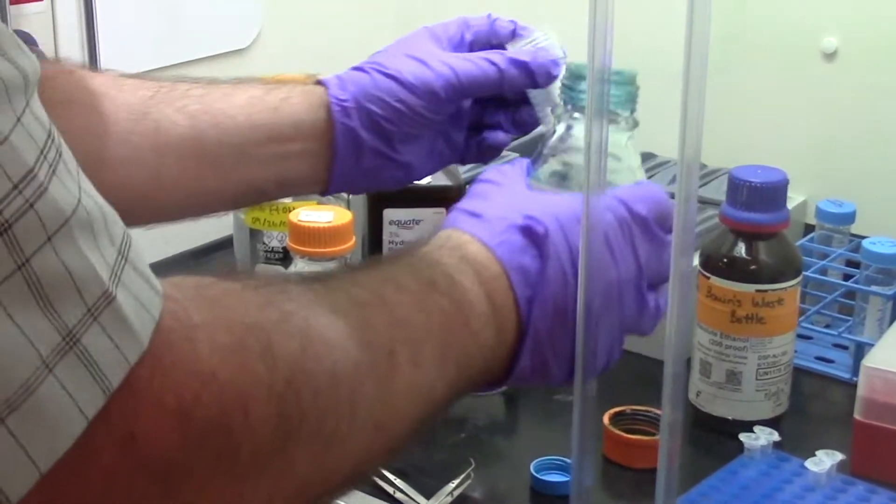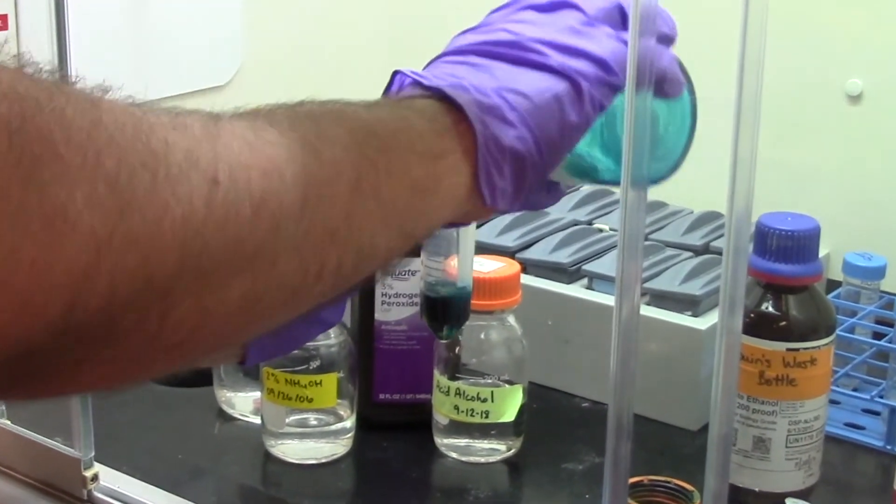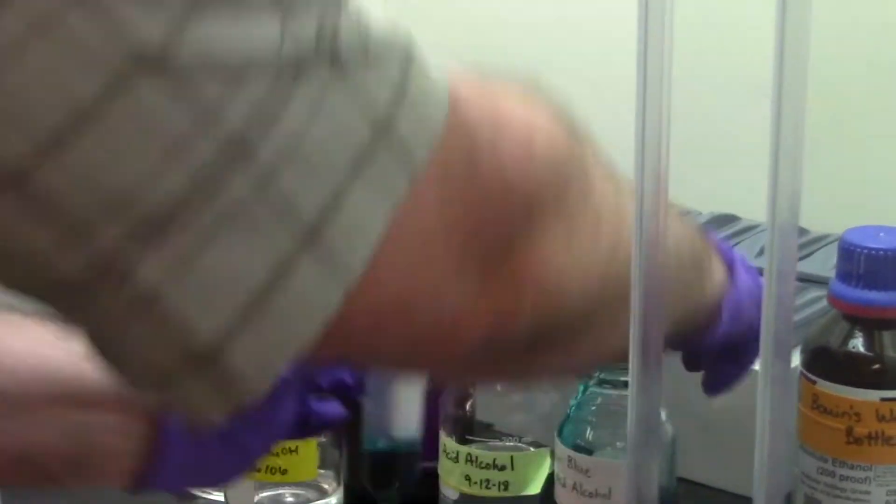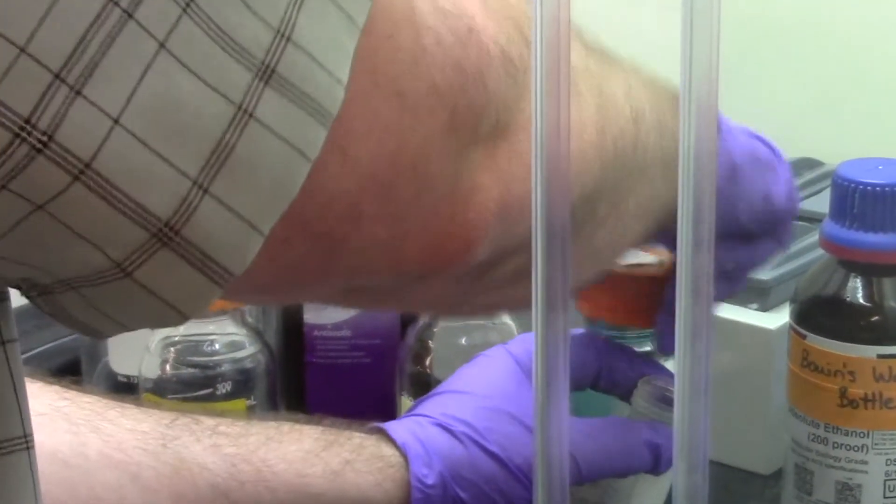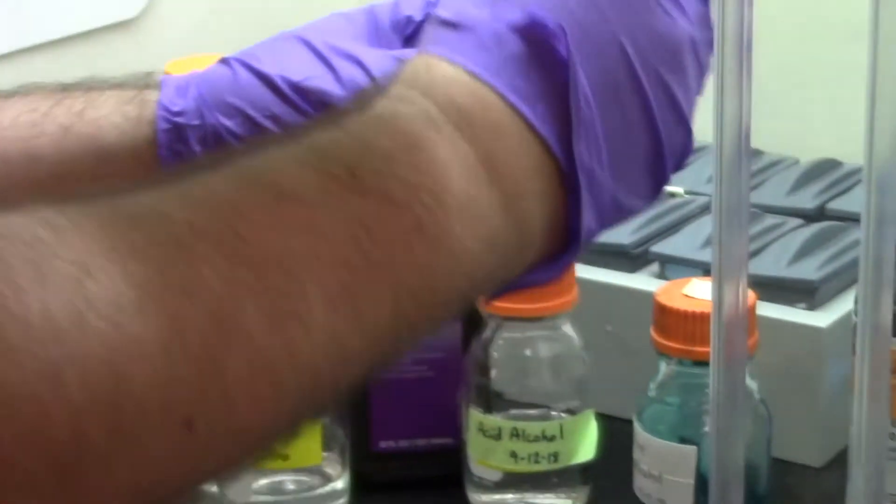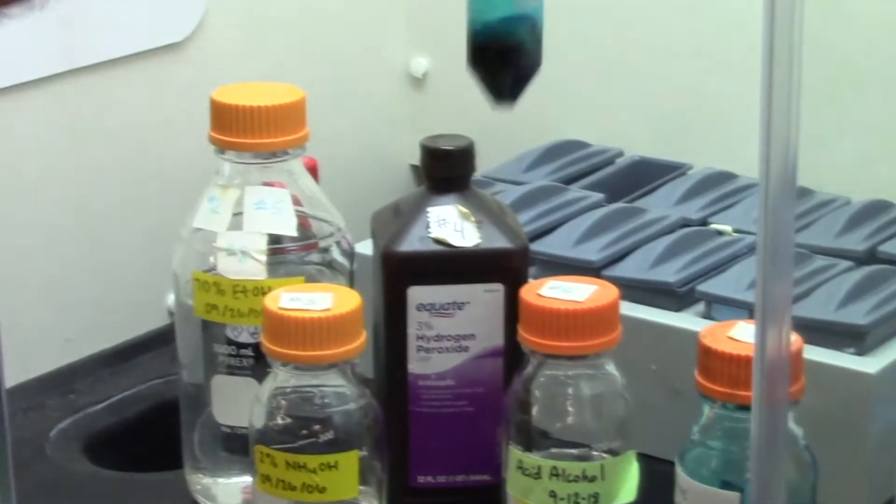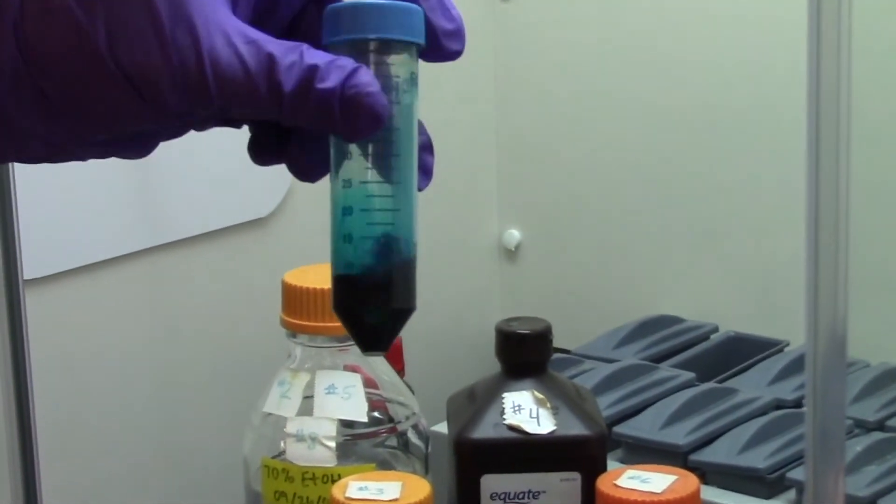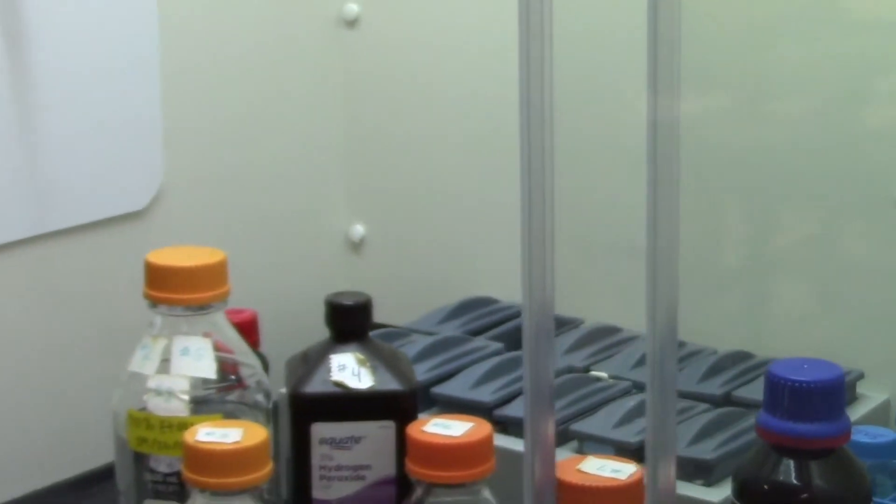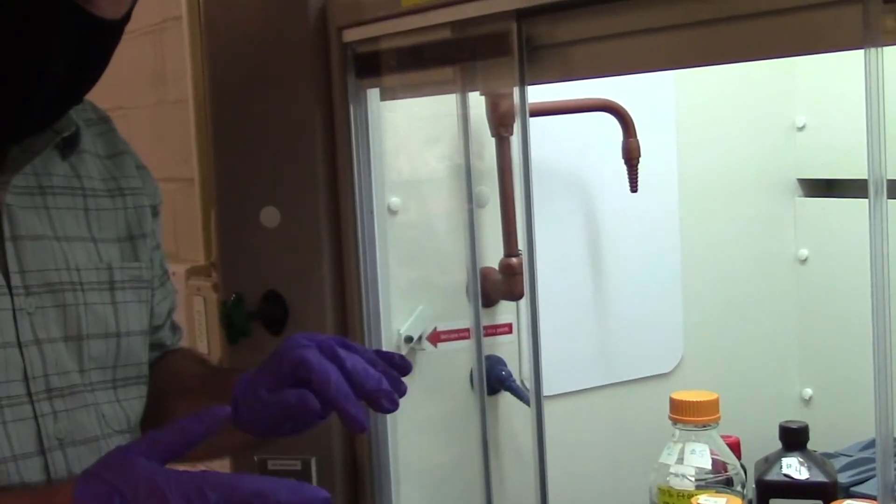This is a typical histology procedure where you have to apply many different washes and rinses and solutions in order to achieve the desired result. Each of these might sit for an hour to two days before you go to the next step. My embryos are now submerged in this very dark blue dye and I will leave them in the hood for a couple days until we come back and then rinse out all the unbound dye.